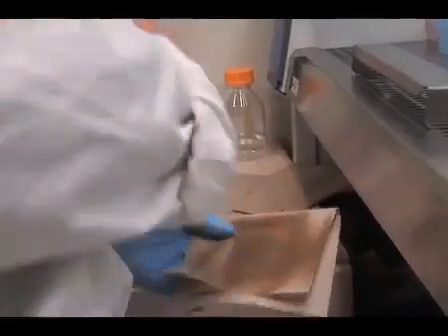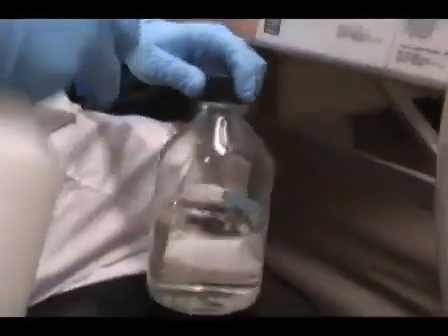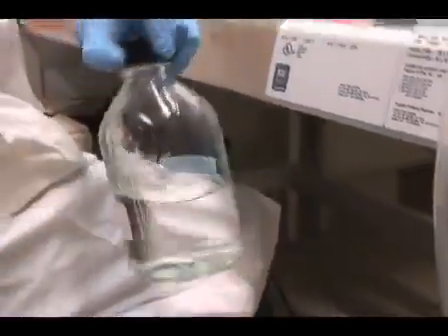When performing cell culture experiments, it is important that a sterile environment is maintained. This involves wiping down the exposed surfaces of an approved flow hood, as well as spraying all reagent bottles and laboratory equipment that enter the hood with 70% ethanol.